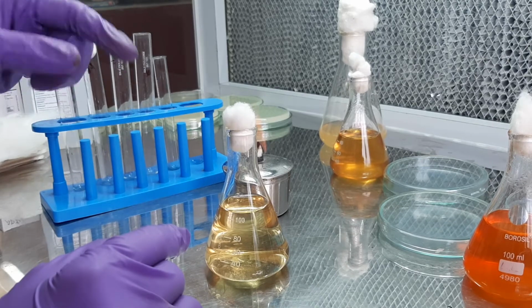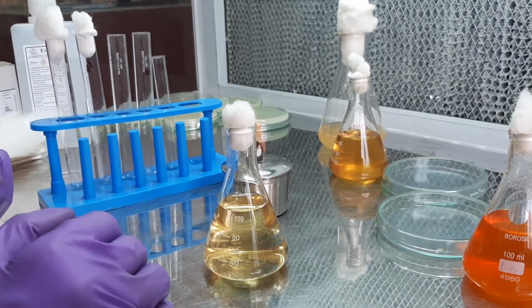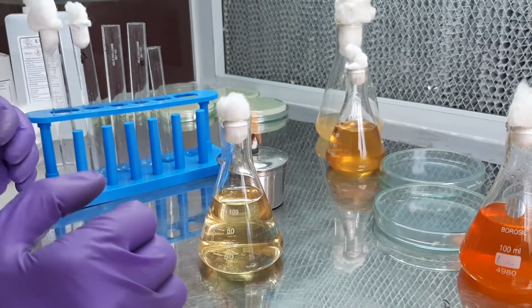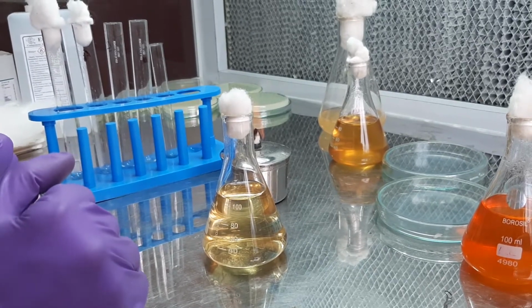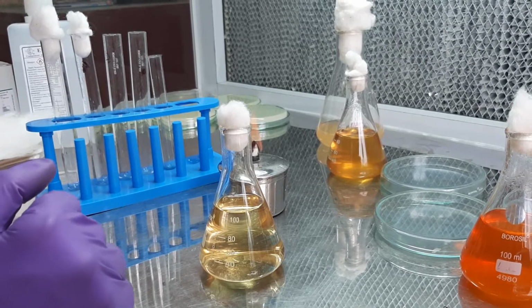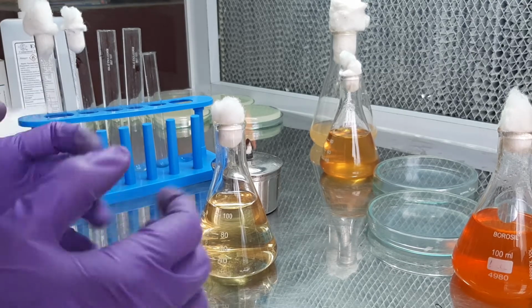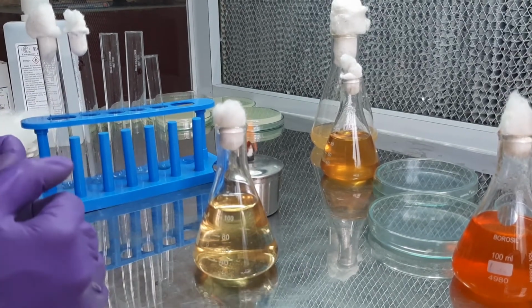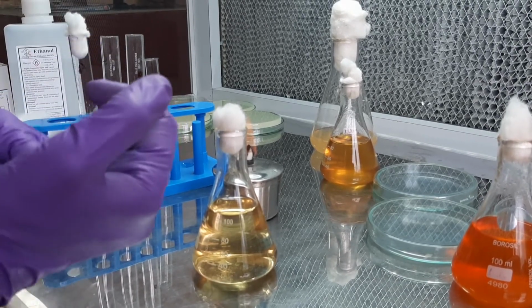A cherry red ring is formed on top of it. So, that is what is indicative of indole production. Now, these biochemical tests are basically carried out to confirm a particular bacterial species. Say, E. coli is a bacteria that will be positive for indole. At the same time, another member of the Enterobacteriaceae family, Klebsiella, will come negative. So, let us see how we carry out this particular test.